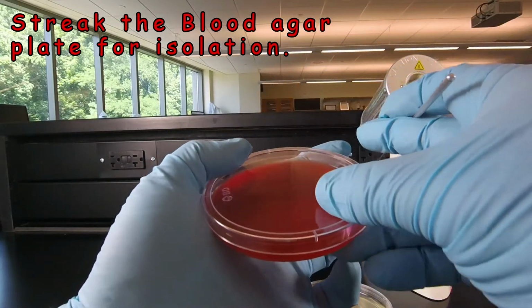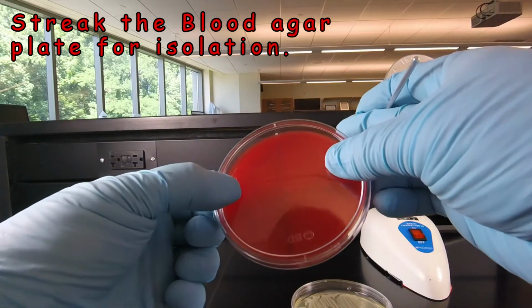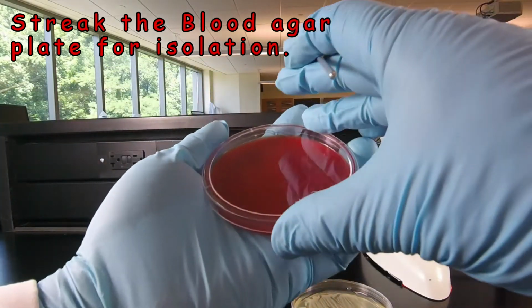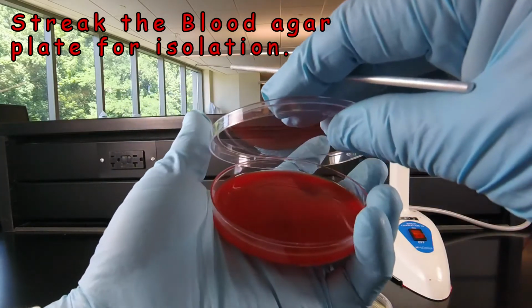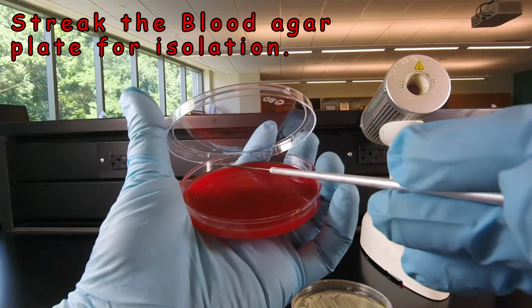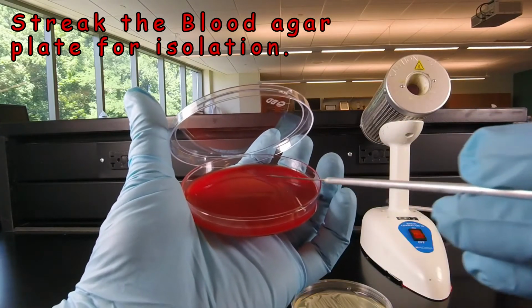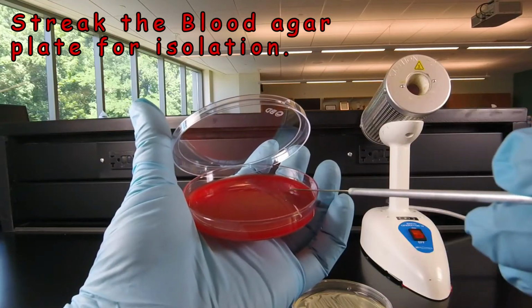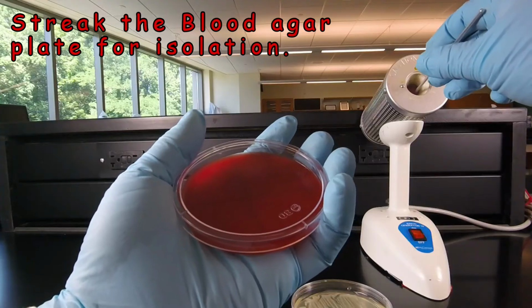Then we're going to rotate the plate so the bacteria up in sector 1 are now sitting at 9 o'clock instead of 12 o'clock. Then we're going to take our sterile loop and spread the bacteria in area 1 over area 2. We'll drag it through maybe 2 times and then spread that out without dragging it through, covering sector 2. Then we're going to sterilize the loop again.